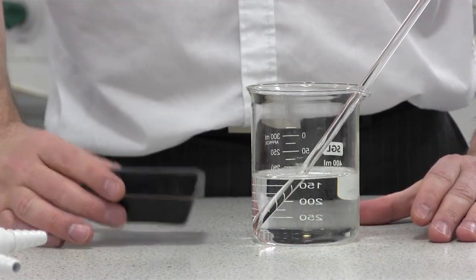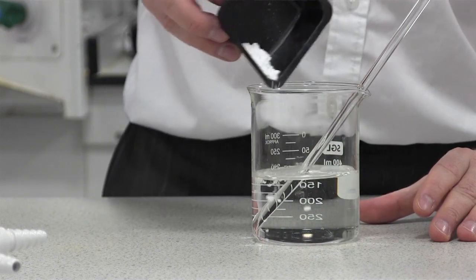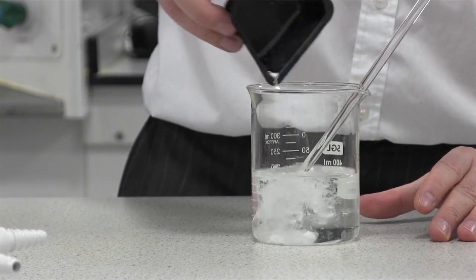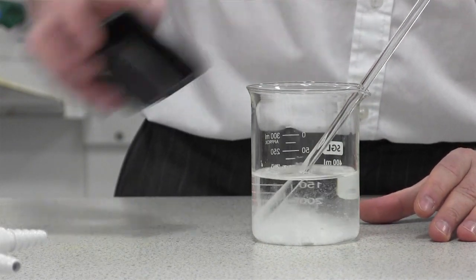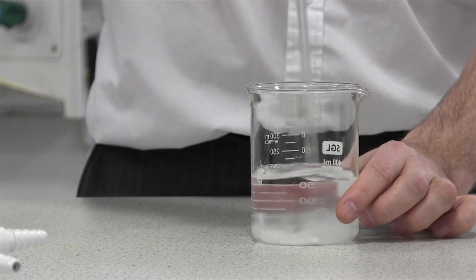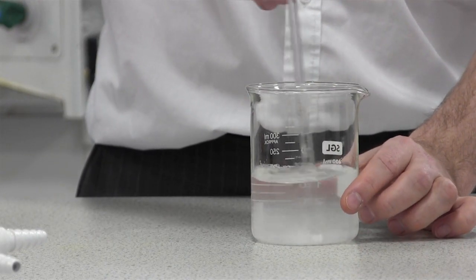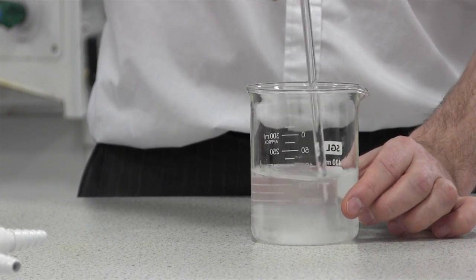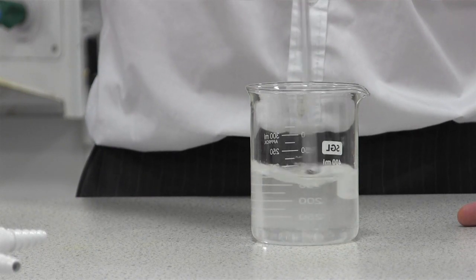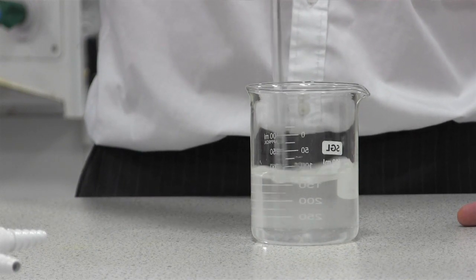Nice and simple — our glucose powder here. Add it to the water. Now you can see already it's started to disperse, but there is still some on the bottom. So using a glass stirring rod, just gently stir it.